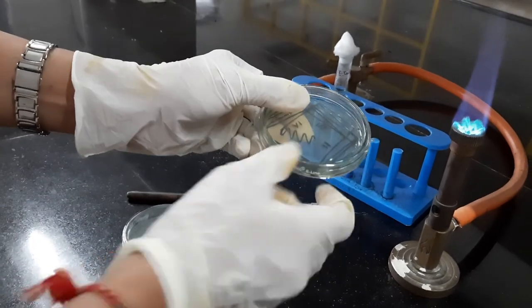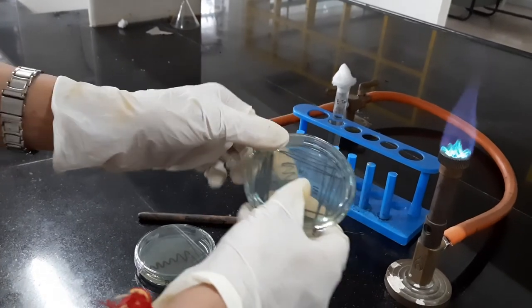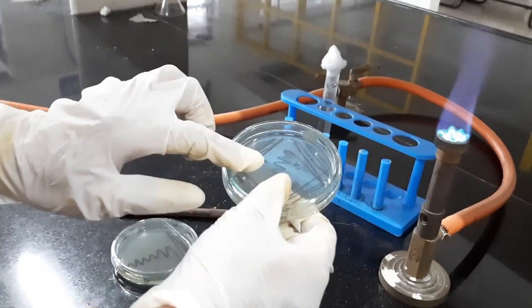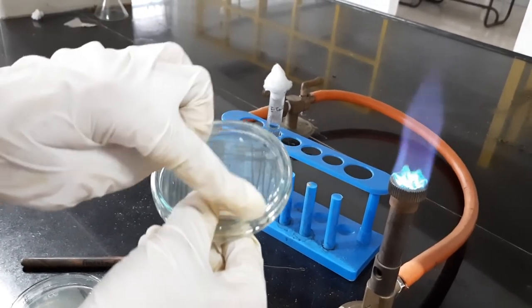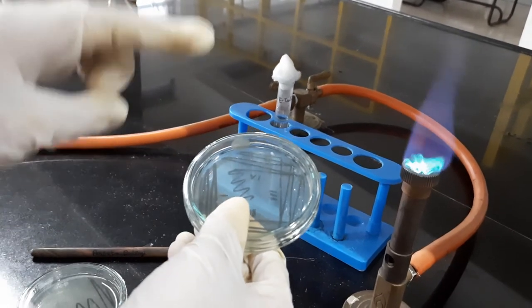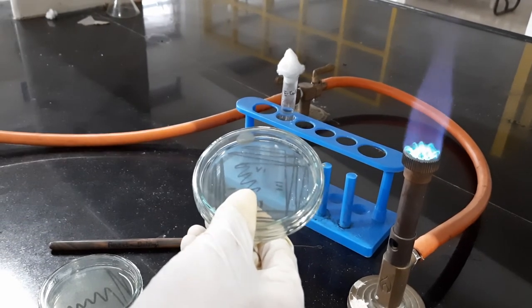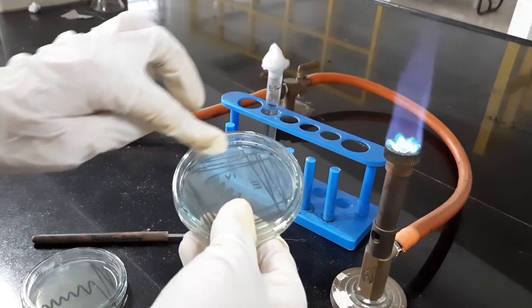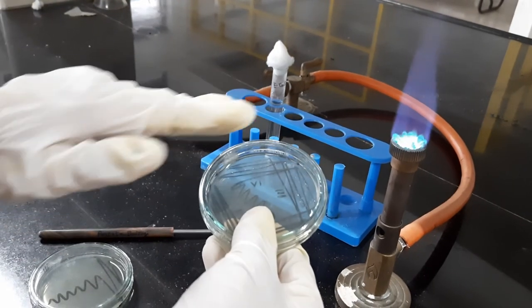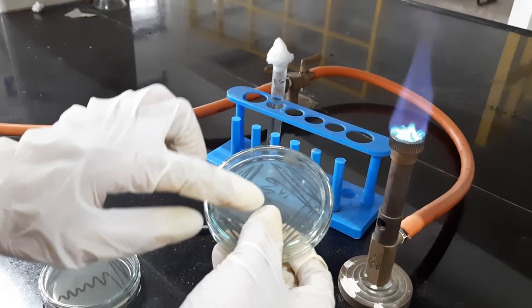As discussed earlier, as you go on streaking, the concentration of the bacteria will keep decreasing and in the end you will get the isolated colonies. The bacterial culture will thin out as you proceed through further quadrants. That is the reason why you don't have to take the bacterial culture every time while streaking — just take it once and streak it through the four quadrants so it thins out, and in the end in the zigzag section you will get the isolated colonies.